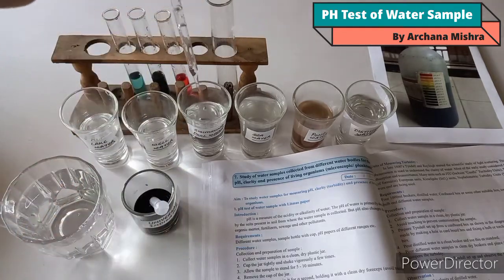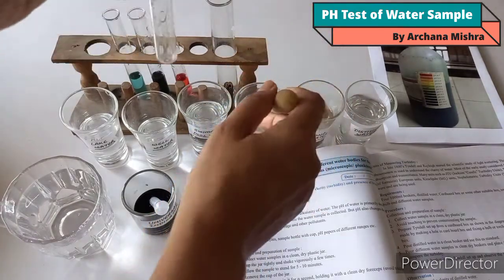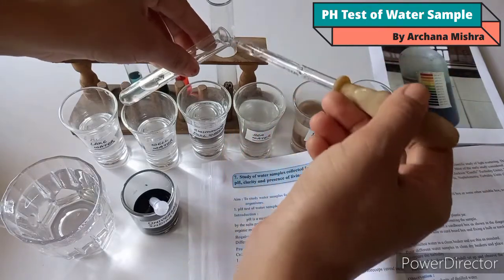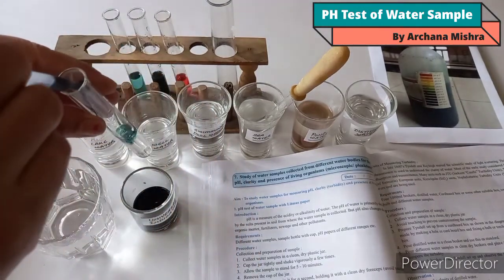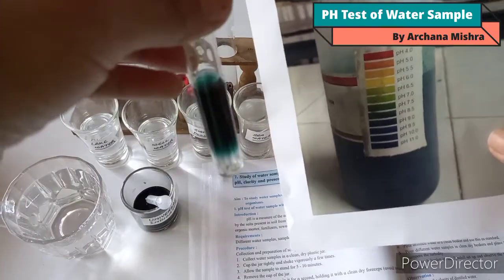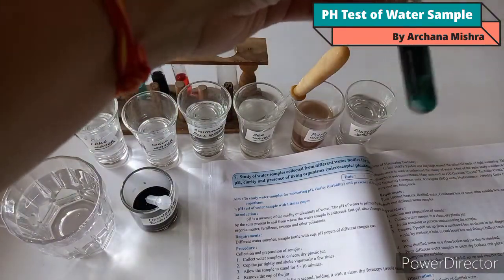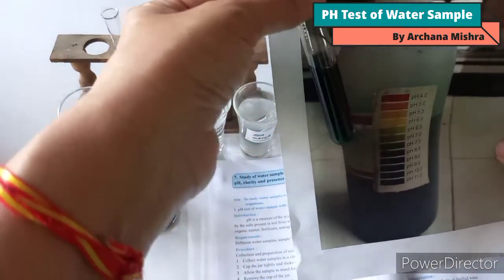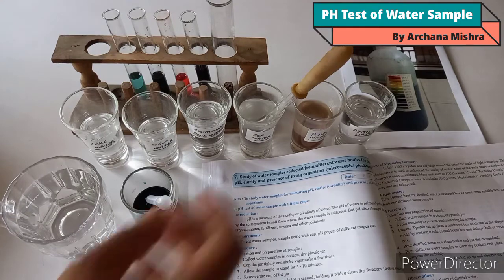Again I wash my dropper in clean water, then take 10 to 15 ml of sea water in a test tube. I add a few drops of universal indicator and observe the color change. Shake the test tube well and match it with the pH color chart. The pH of sea water is 9. Record your observation — pH of sea water is 9.